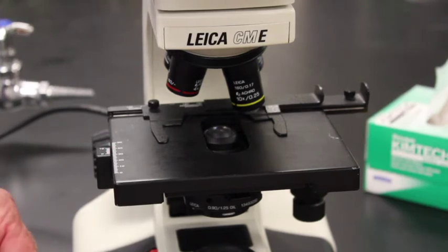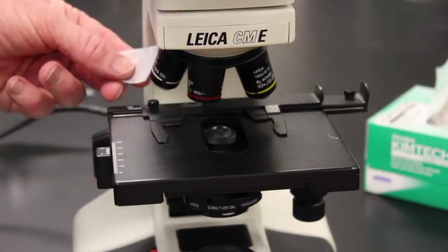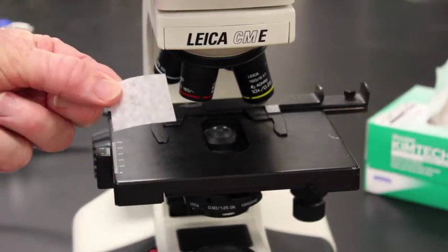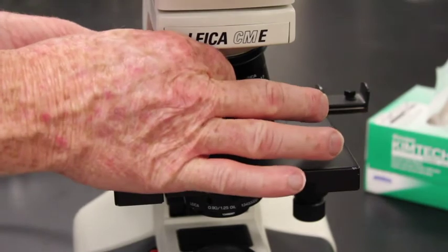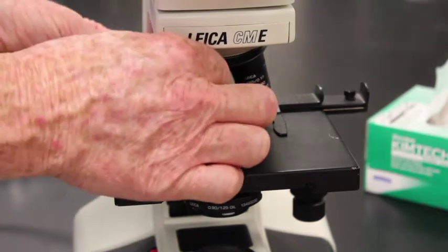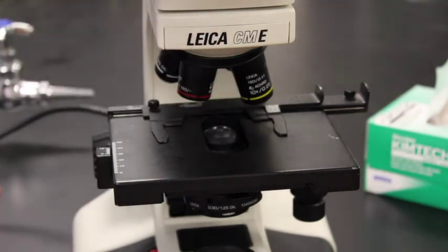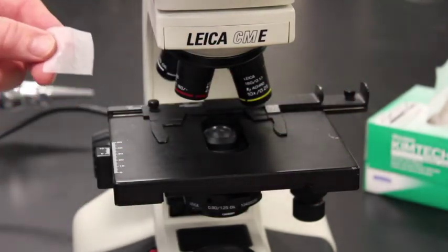Now, if we go over to the 100x objective, we have a lot of oil on it. So I'm going to swivel it back over here. Here's my 100x objective, and if I wipe it, we can see all that translucence of the oil. So I'm going to go back and wipe it again. Really it might take 2 or 3 times with a clean piece of lens paper, where I wipe in various clean spots. I might shift it and go to a nice clean spot, and then wipe it. I grab a brand new piece, wipe it, and if I have no translucence at all, it's ready to go.